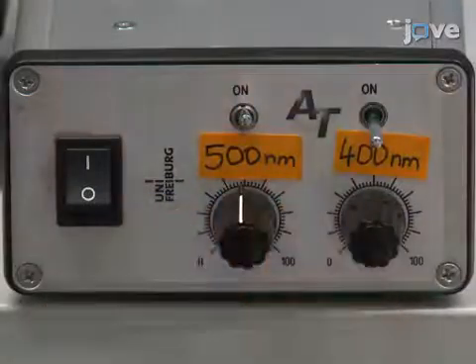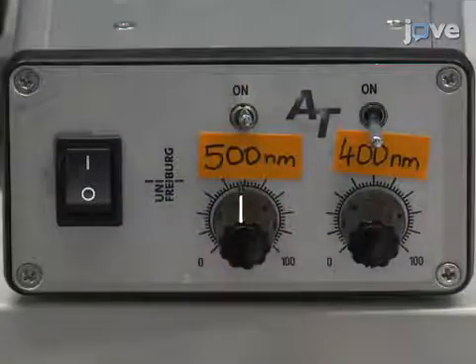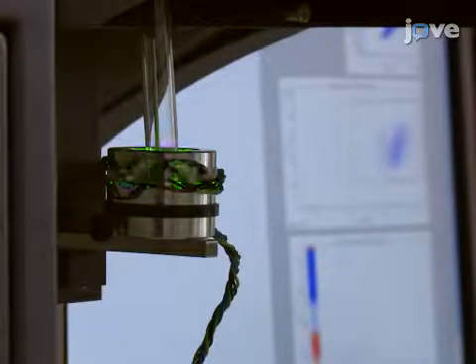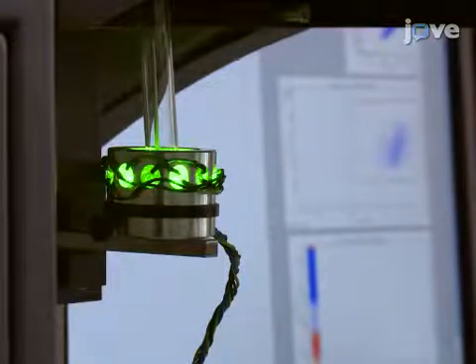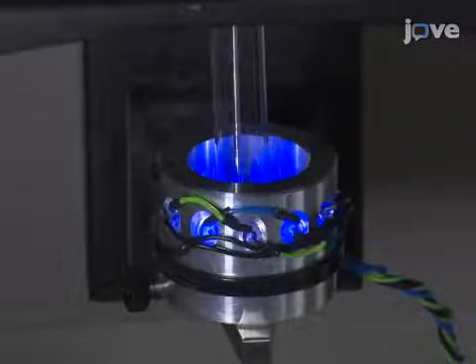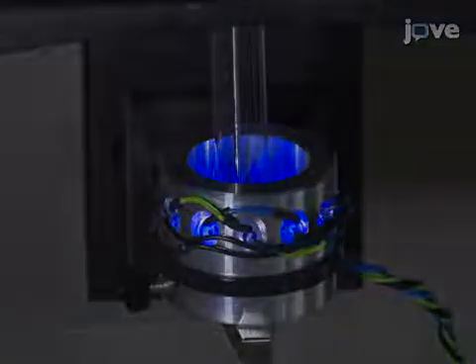Increase the intensity of the LED lights until DRONPA fluorescence intensity decreases in order to estimate the minimal light intensity needed in order to measure the photo-switching of the DRONPA linker DRONPA protein. Next, switch on the 400 nanometer LED light of the prototype at the outside of the tube and continue measuring the fluorescence intensity of DRONPA.